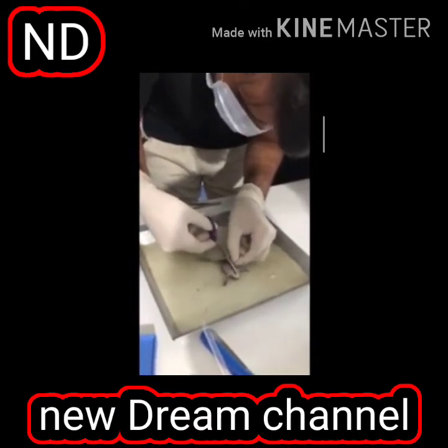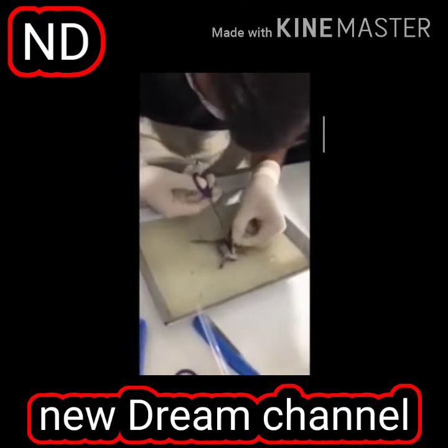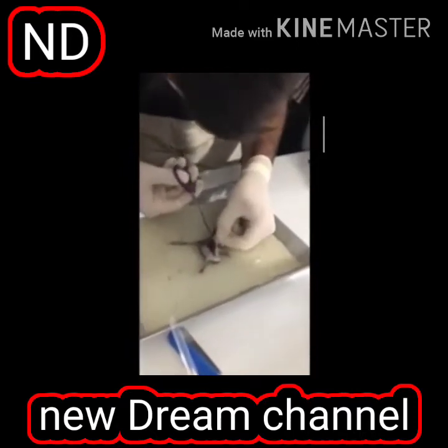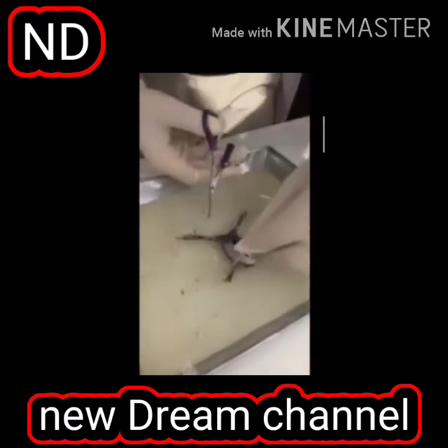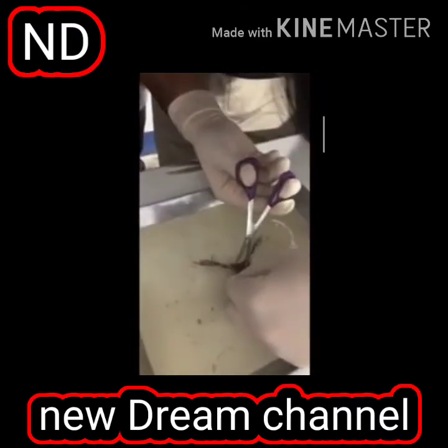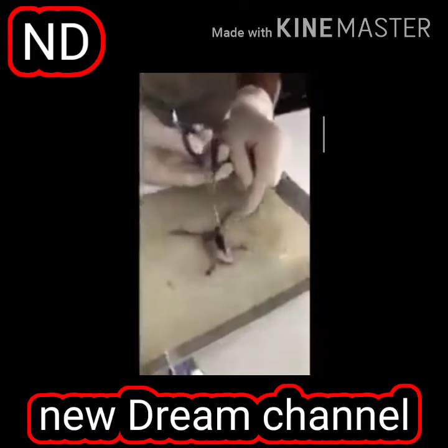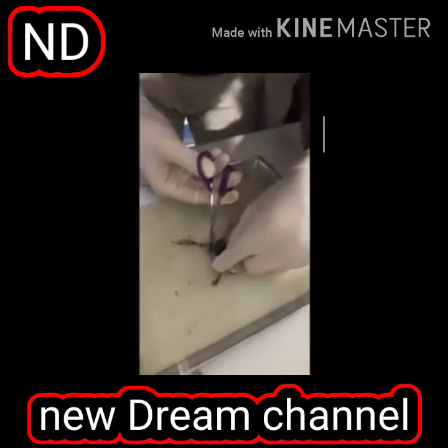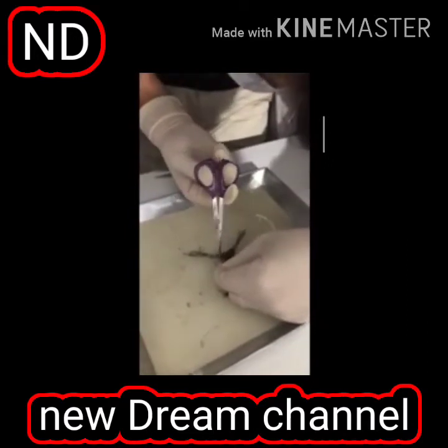We'll cut it like this, but you have to save this part. This is peritoneum. We'll cut it here like this. We'll take this skin fold. Everybody should be able to do their own dissections in next classes.